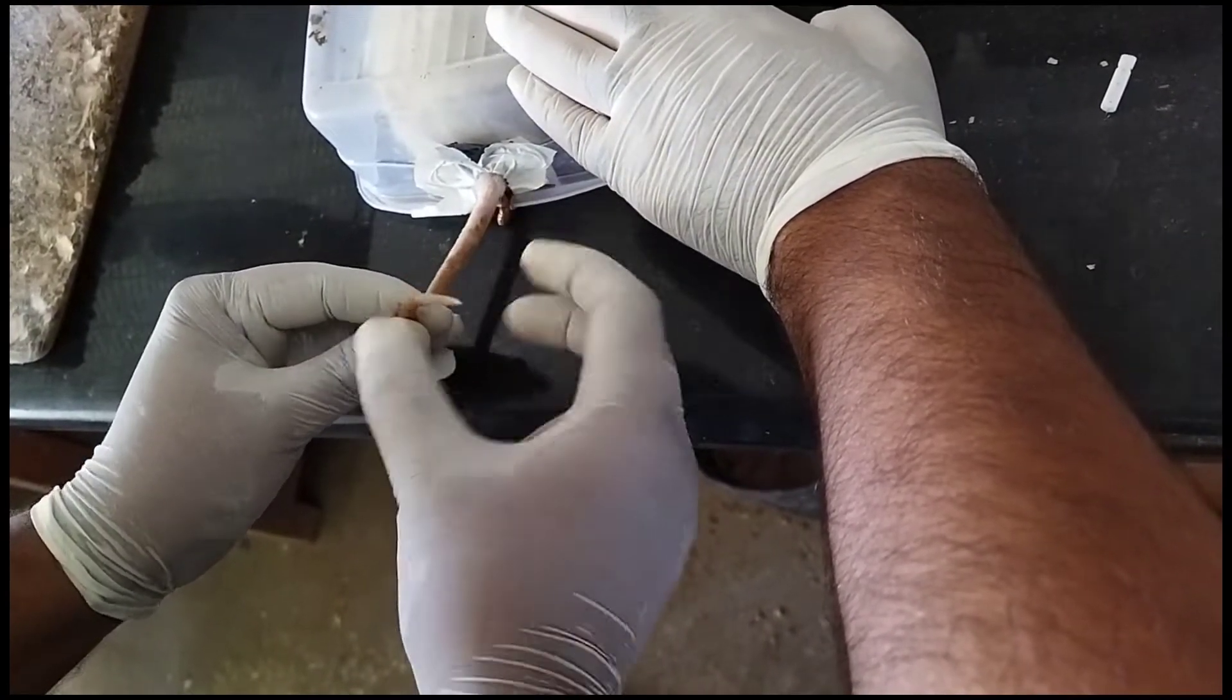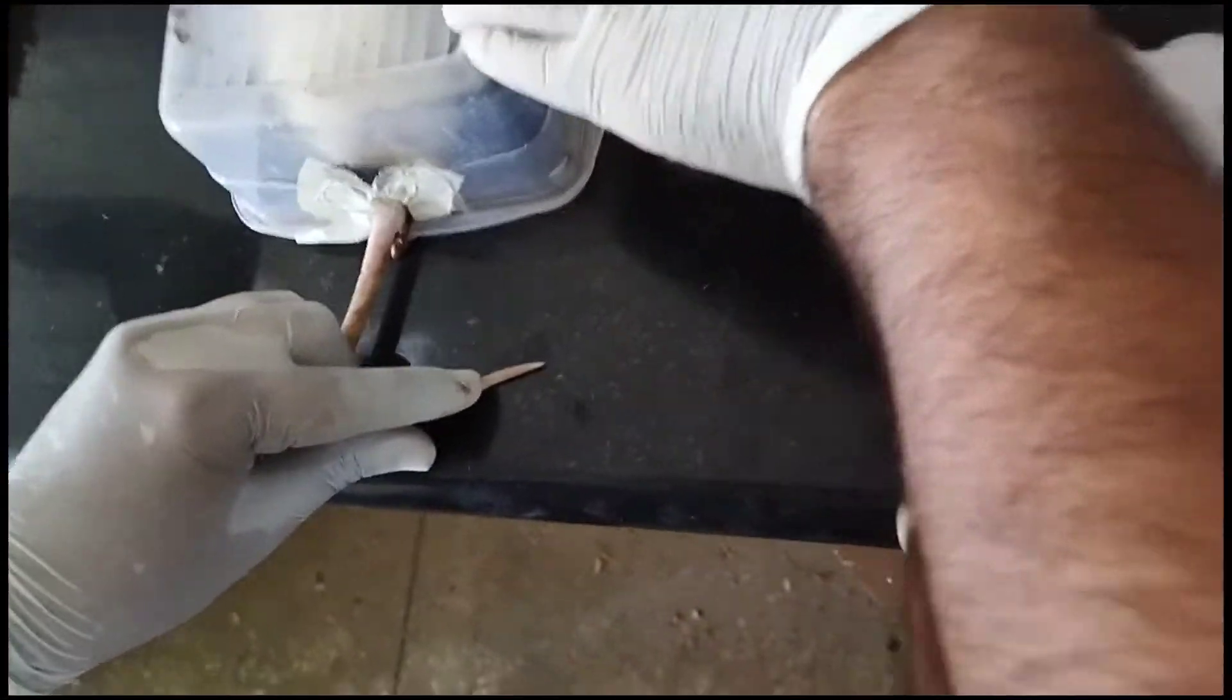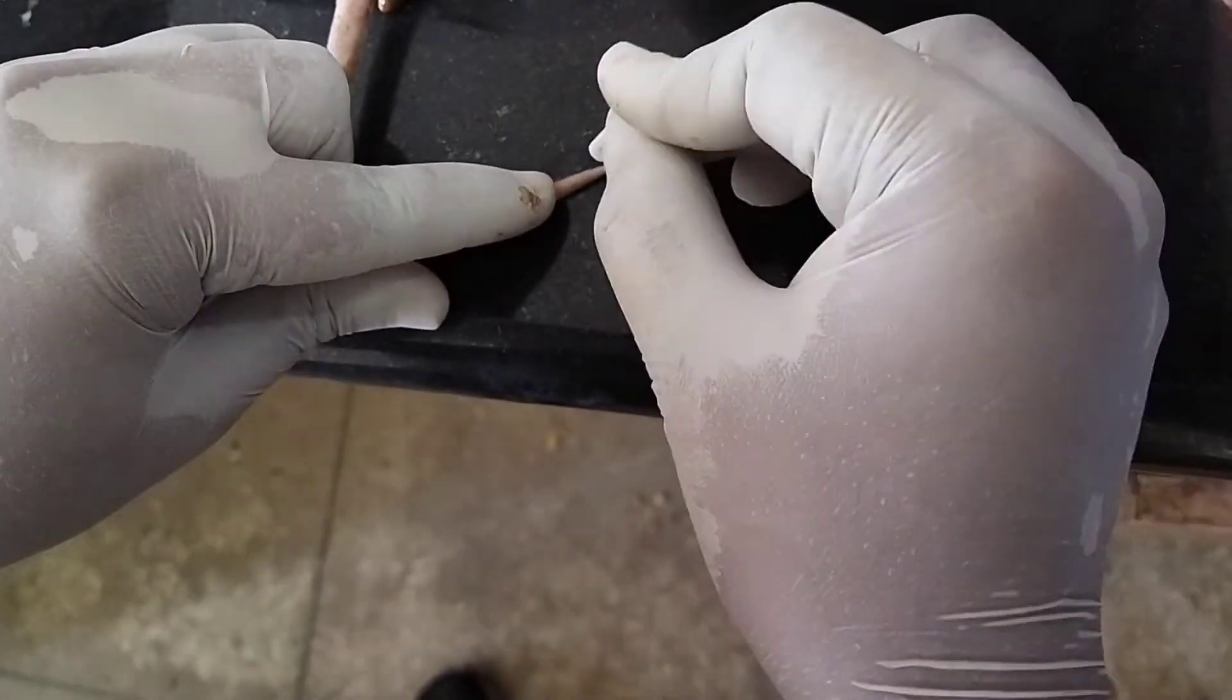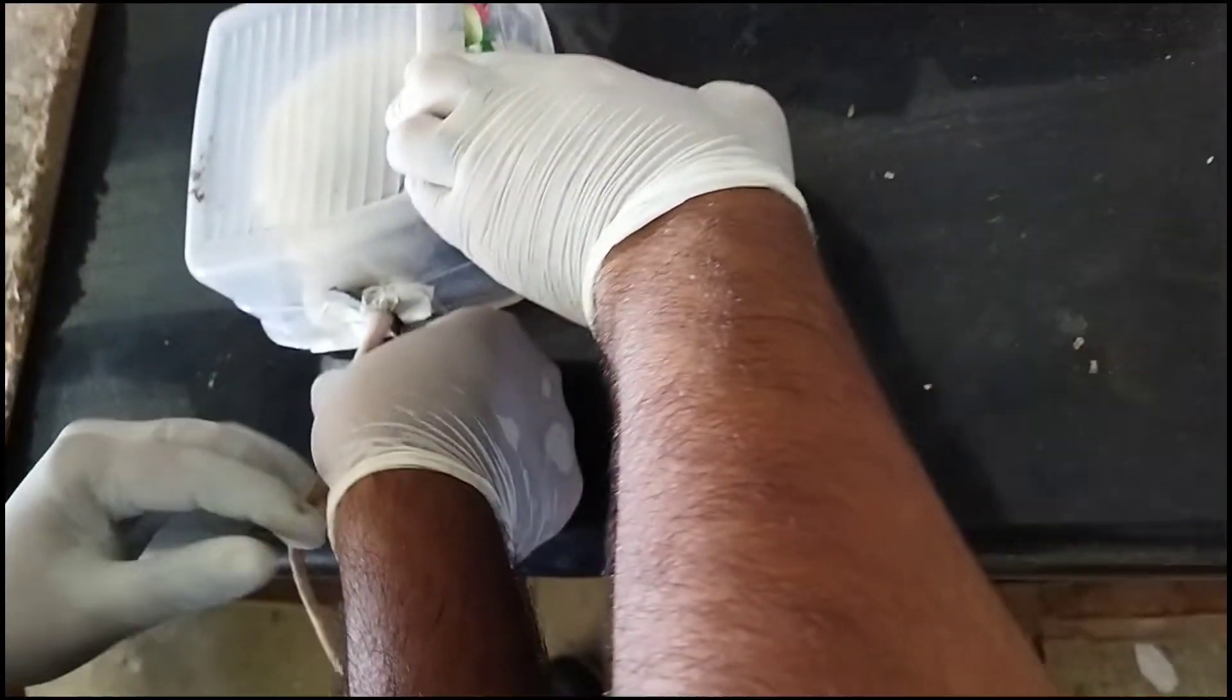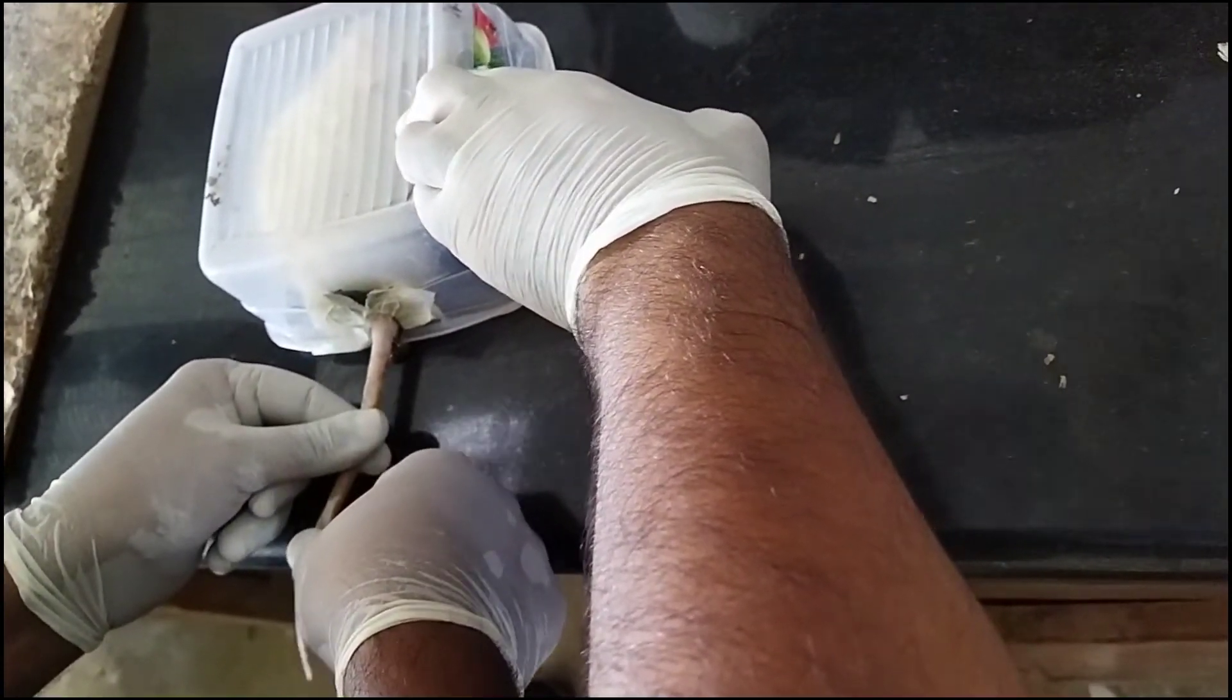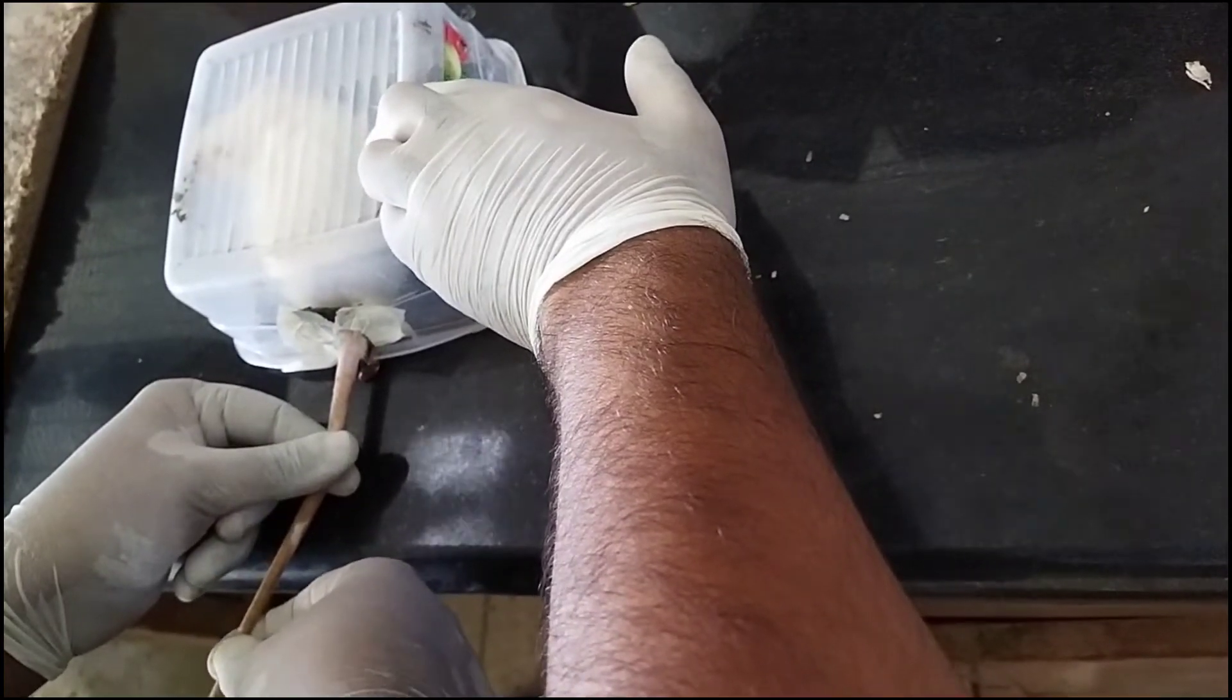I'm going to prick it by my hands. I'm not using a gun over here right now. You have to prick at the bottom end of the tail. After pricking, do a little massage so it will make a good drop of blood.